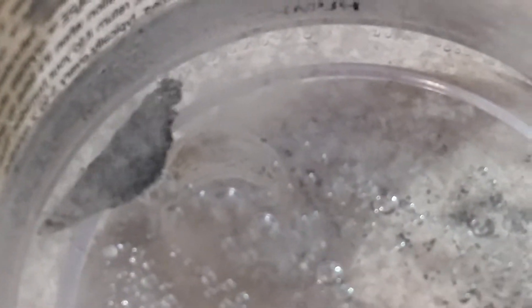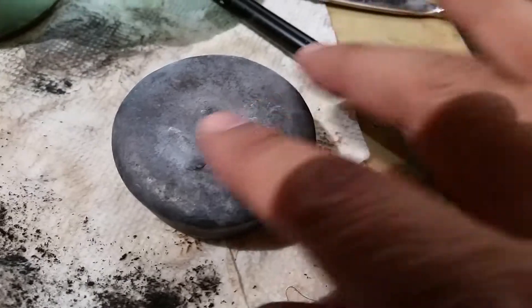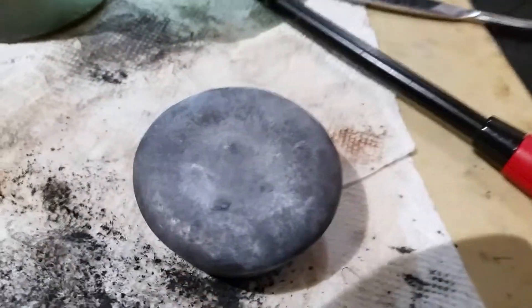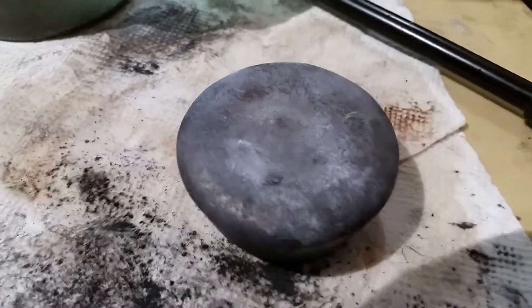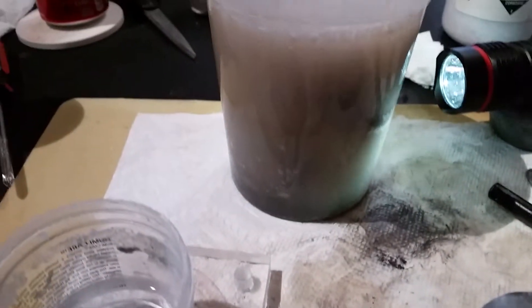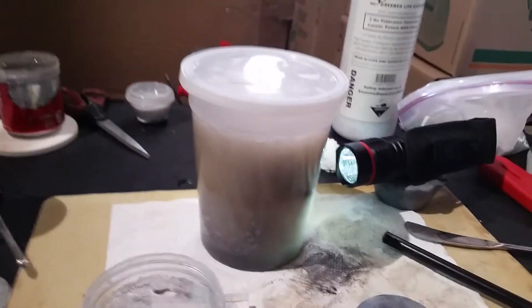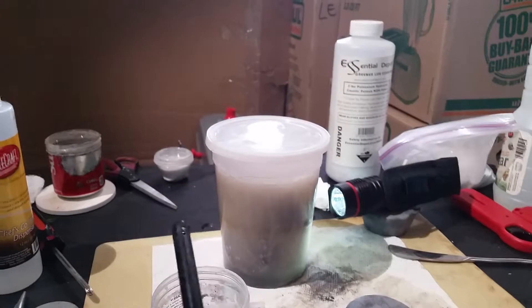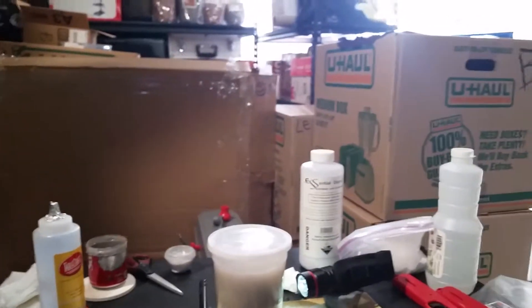This is my aluminum piece in there, still producing. We've gone a little bit bigger. This is an ingot of aluminum — it's a little dark, it's been submerged in potassium hydroxide. This is my reaction chamber right now; there are about four to five pieces of aluminum ingot in there. I'm about to light this for you so you can see what it will do.